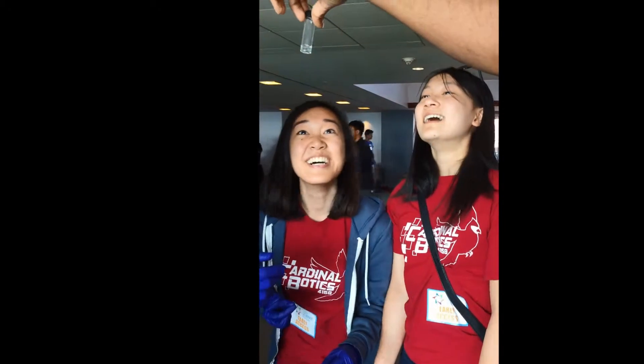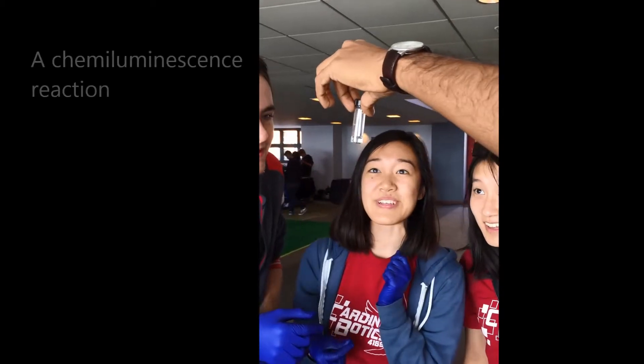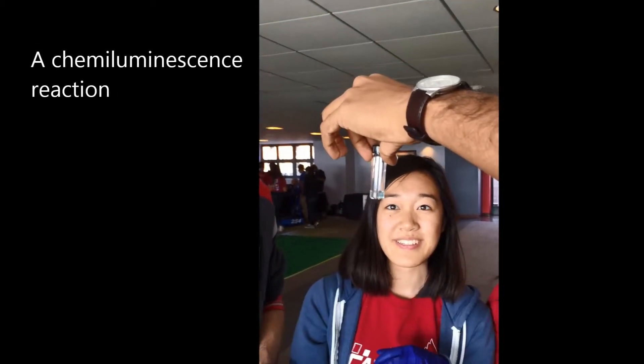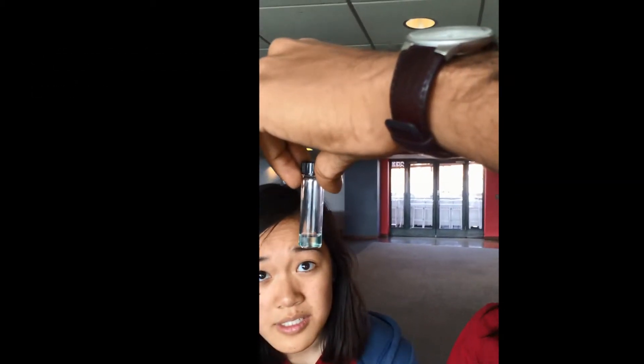You can actually see the change of color. I see the color. And you can see how the color first looks near the gel, and it's kind of shifting out of the solution. That's why I'm trying to state the local reaction.